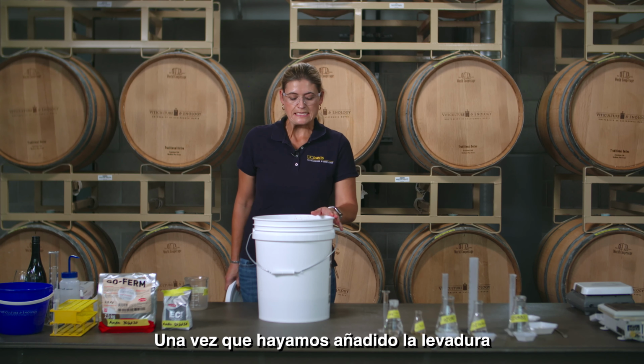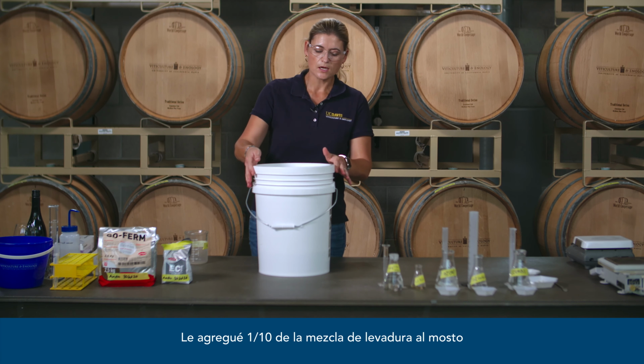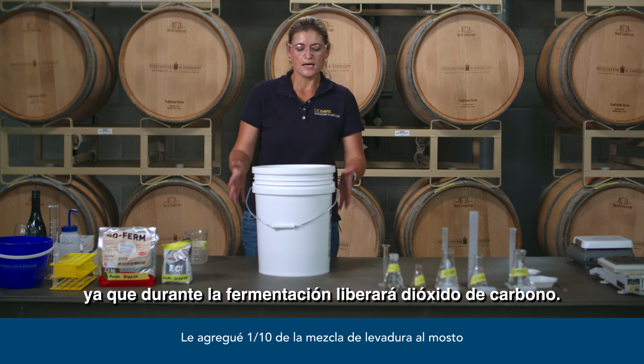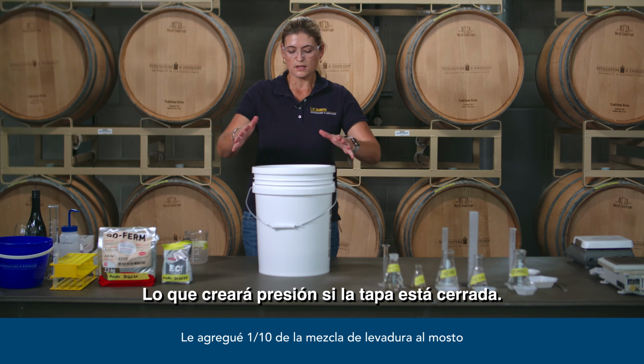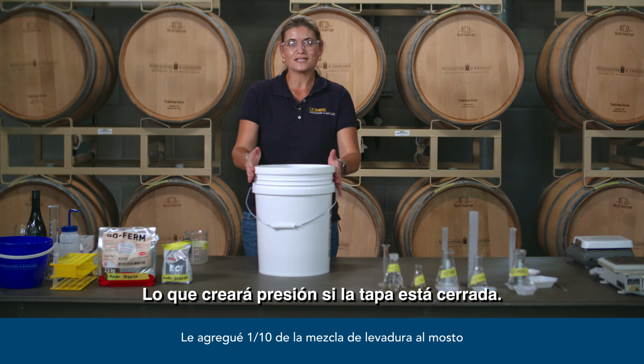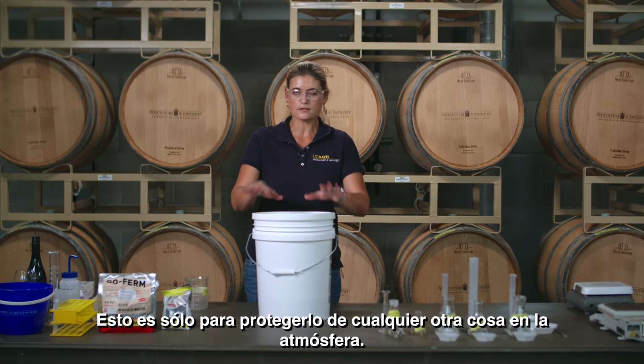After we've added our yeast and mixed it in well, we'll add a lid just loosely. We do not want to seal it tightly, as during fermentation it will release carbon dioxide, which will build up pressure if the lid is sealed. So if it's just loosely on there, the carbon dioxide that gets released from the fermentation can just escape your container. This is just to protect it from anything else in the atmosphere.